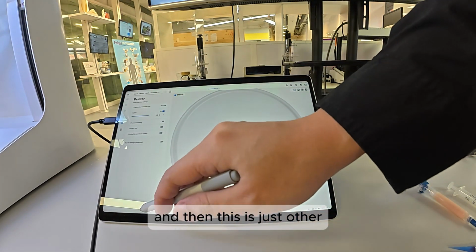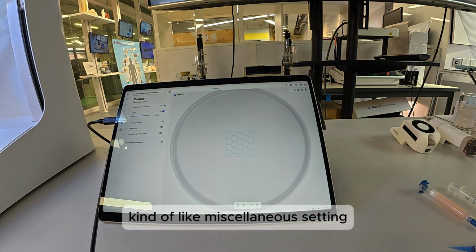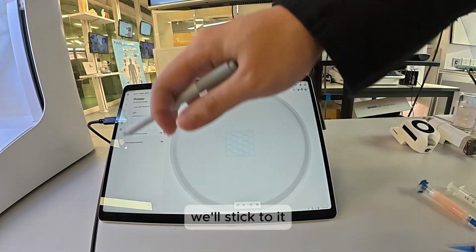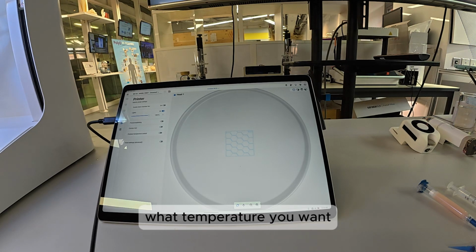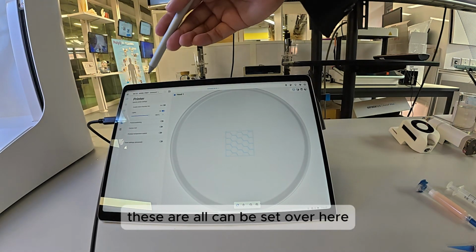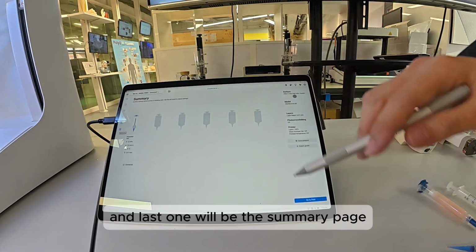And then this is just other kind of miscellaneous setting. For this one, we'll stick to it, but this one you can actually decide what lighting you want during the printing, what temperature you want, whether you need photo crosslink between the printing. These can all be set over here. There is question number 5. And the last one will be the summary page.